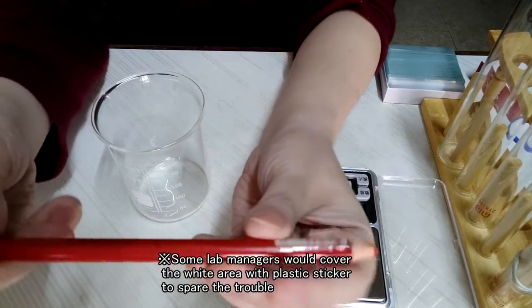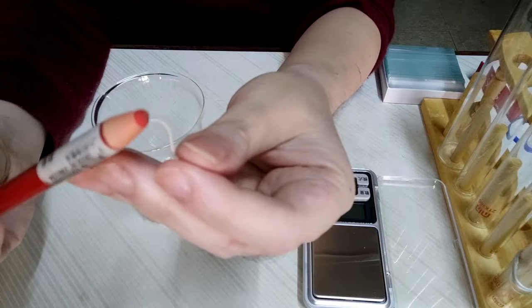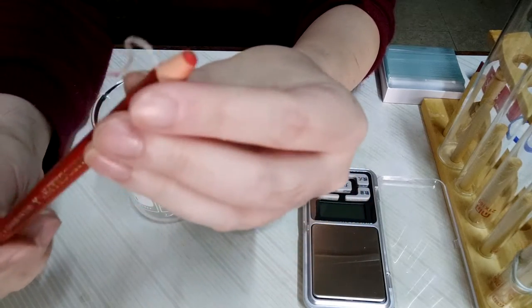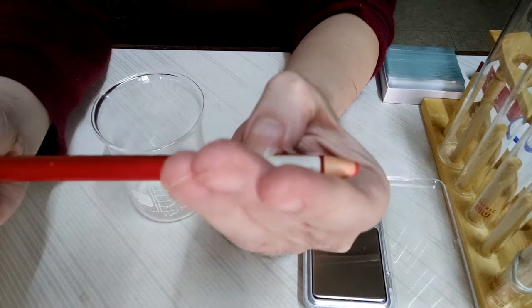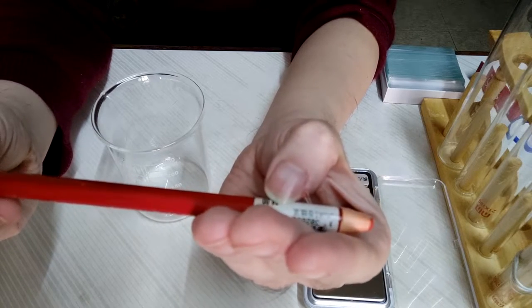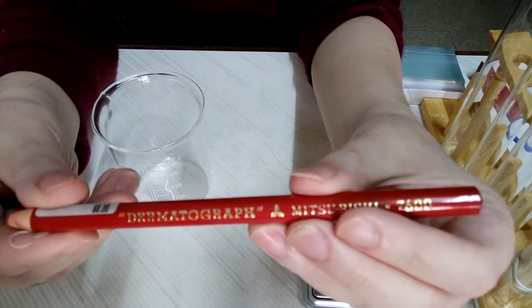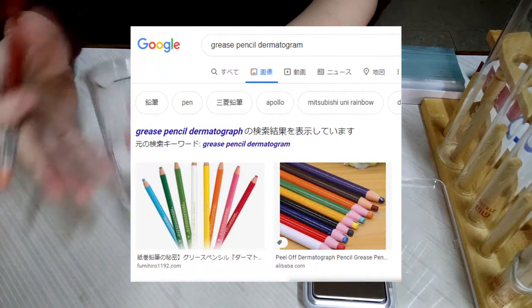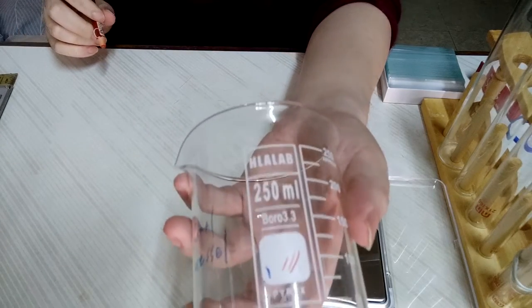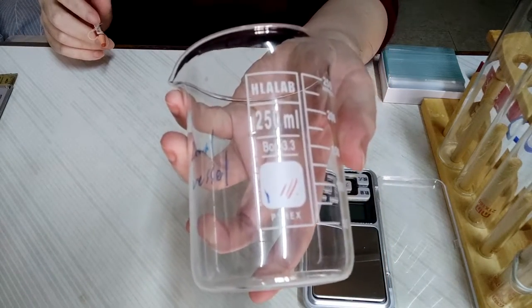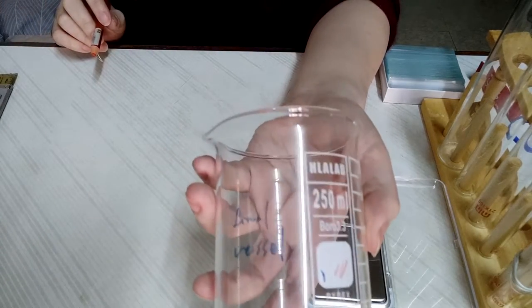which is actually similar to wooden color pencil. So this one I have here is made from Japan, Mitsubishi, under the brand name Dermatograph. So at the end of the experiment, I will clean both marks and see which one is easier or more difficult to clean.